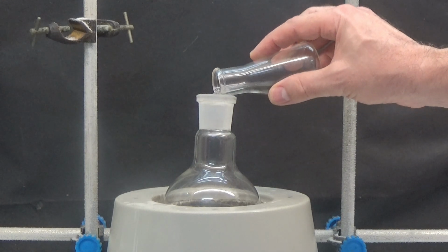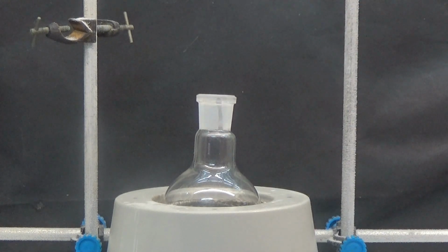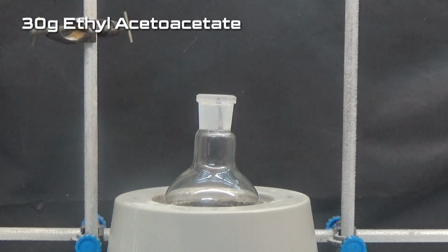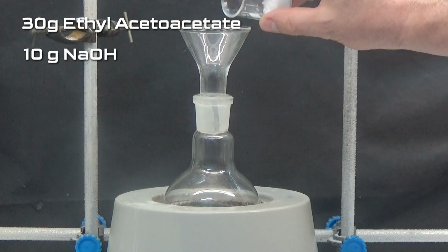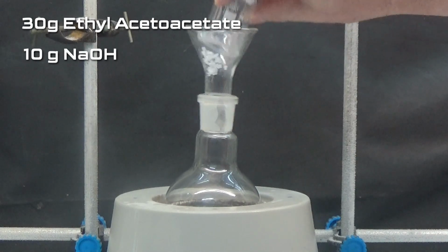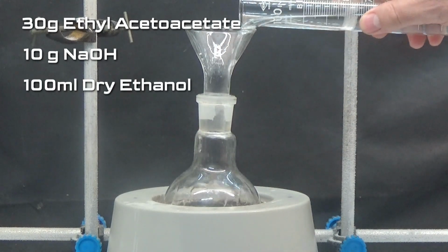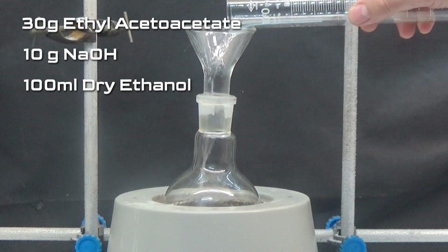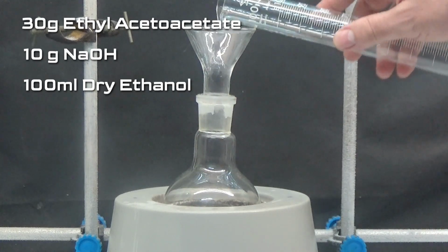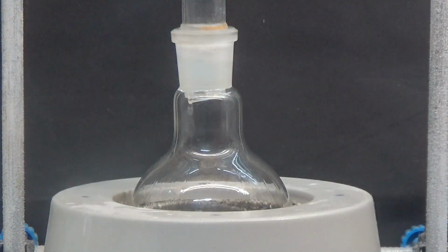To obtain the sodium salt of acetoacetic acid, in a 250 ml flask with reflux condenser, put 30 grams of ethyl acetoacetate, 10 grams of sodium hydroxide and 100 ml of dry ethanol. Protect the system from humidity with calcium chloride tubing. The mixture is heated for 1 hour at reflux.